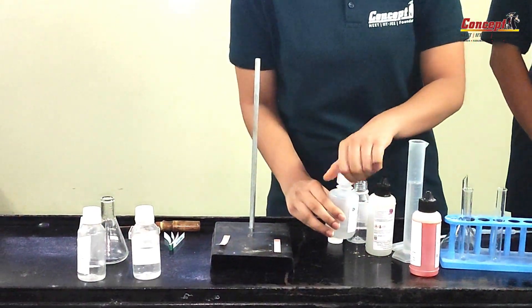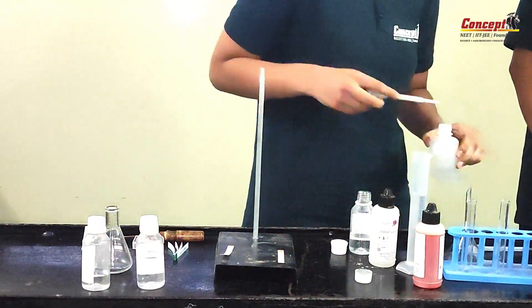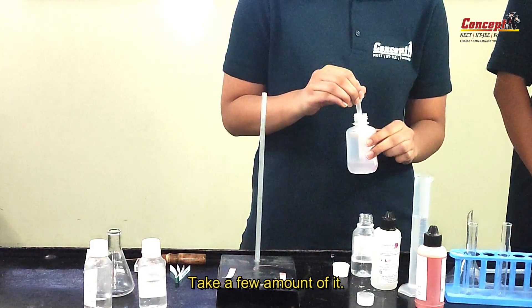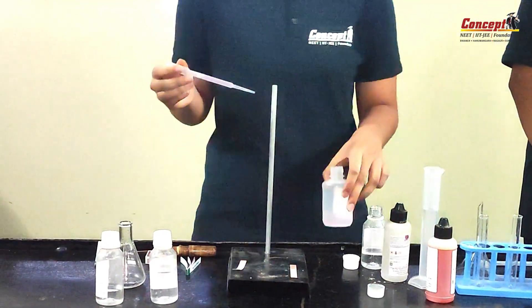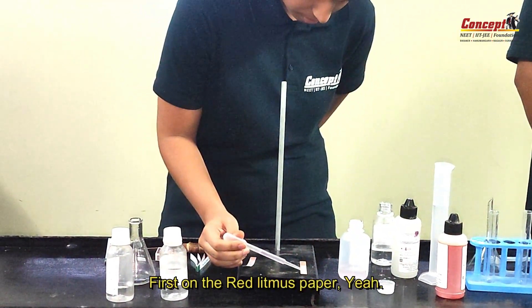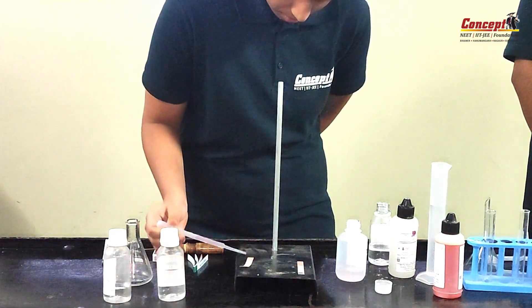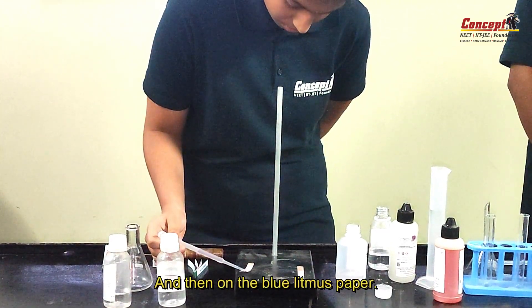Take the base sample. Take a small amount of it — first add it on the red litmus paper, and then on the blue litmus paper.